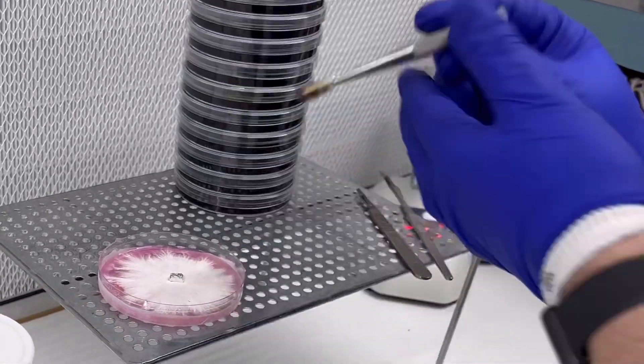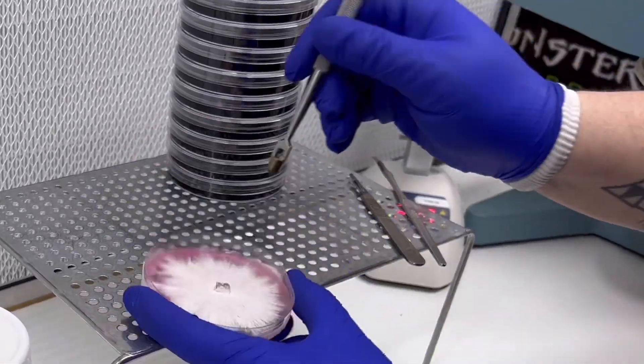Super quick video on how to use our agar punches and agar punches in general.